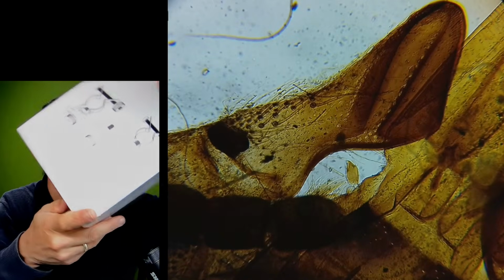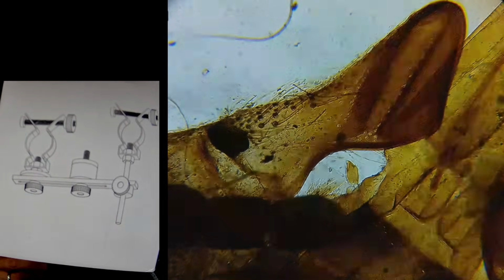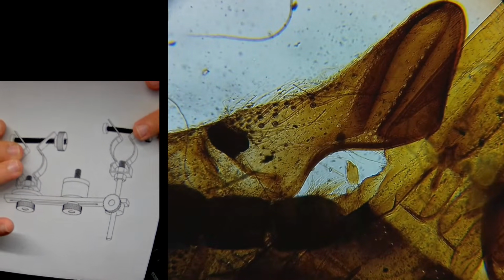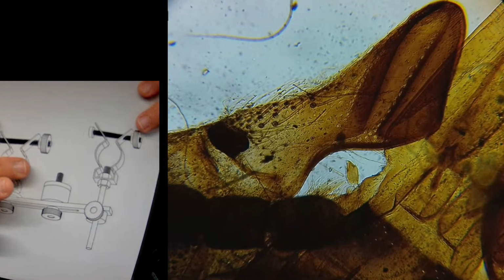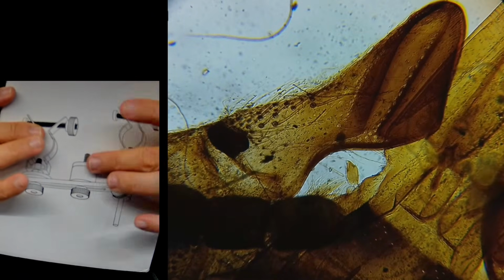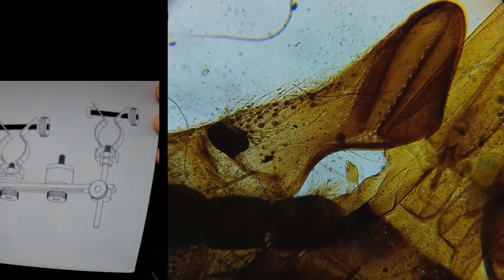It just came like this. That's how it looks like, and it simply has all of the parts mounted, so you don't use it like that, obviously, right? You only need one of the clamps, but they're for two different eyepiece sizes, and you can kind of configure it as you want. So that's kind of how it looks like.